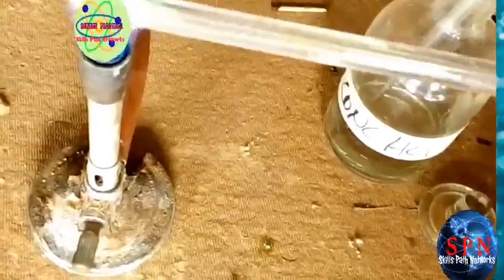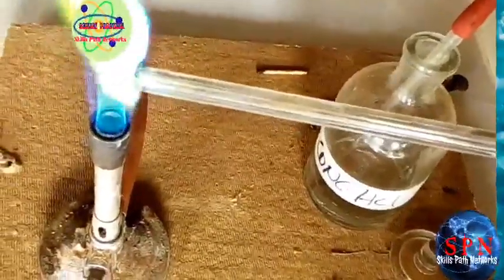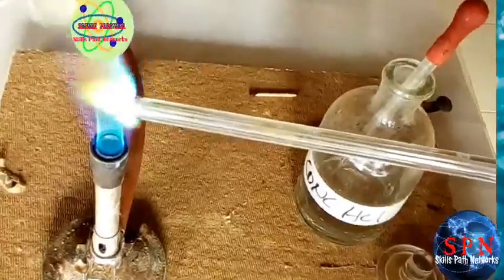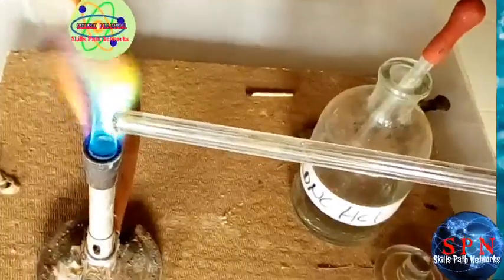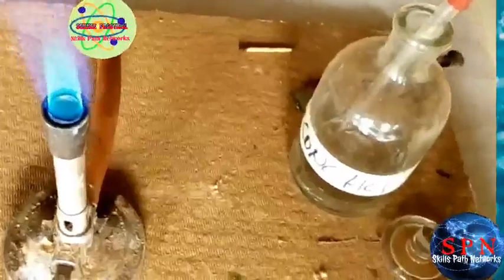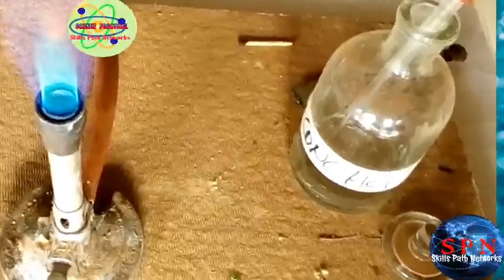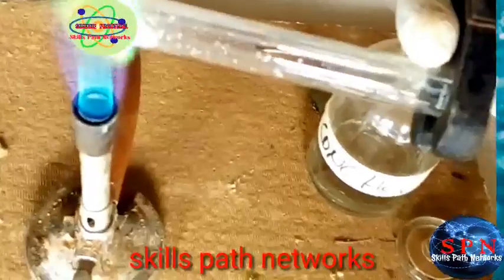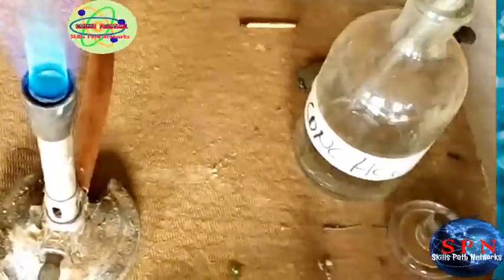You see the flame, blue-green. That is the flame test of copper 2 sulphate. Then instead of a glass rod, you can use the side of a test tube, but that is the same procedure.